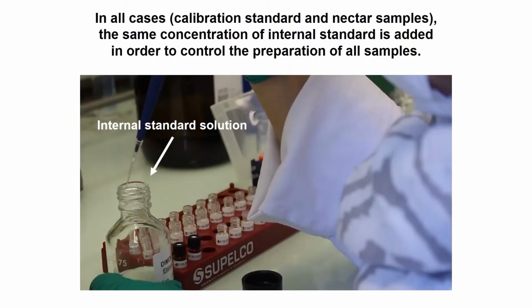In all cases, calibration standard and nectar samples, the same concentration of internal standard is added in order to control the preparation of all samples.